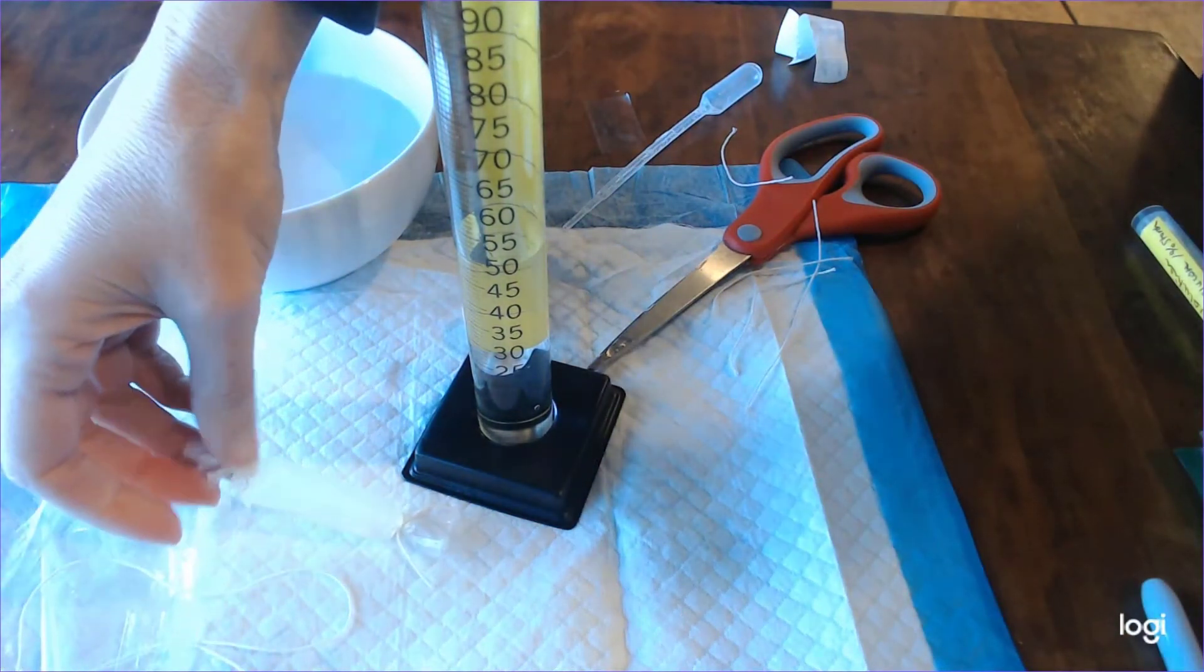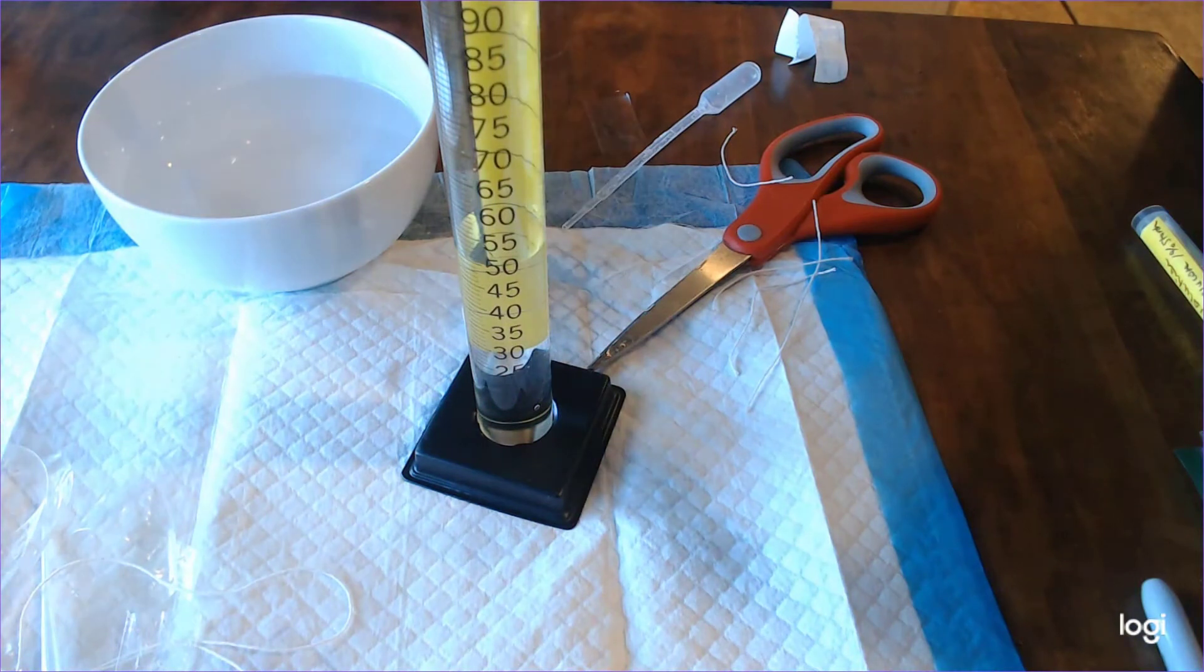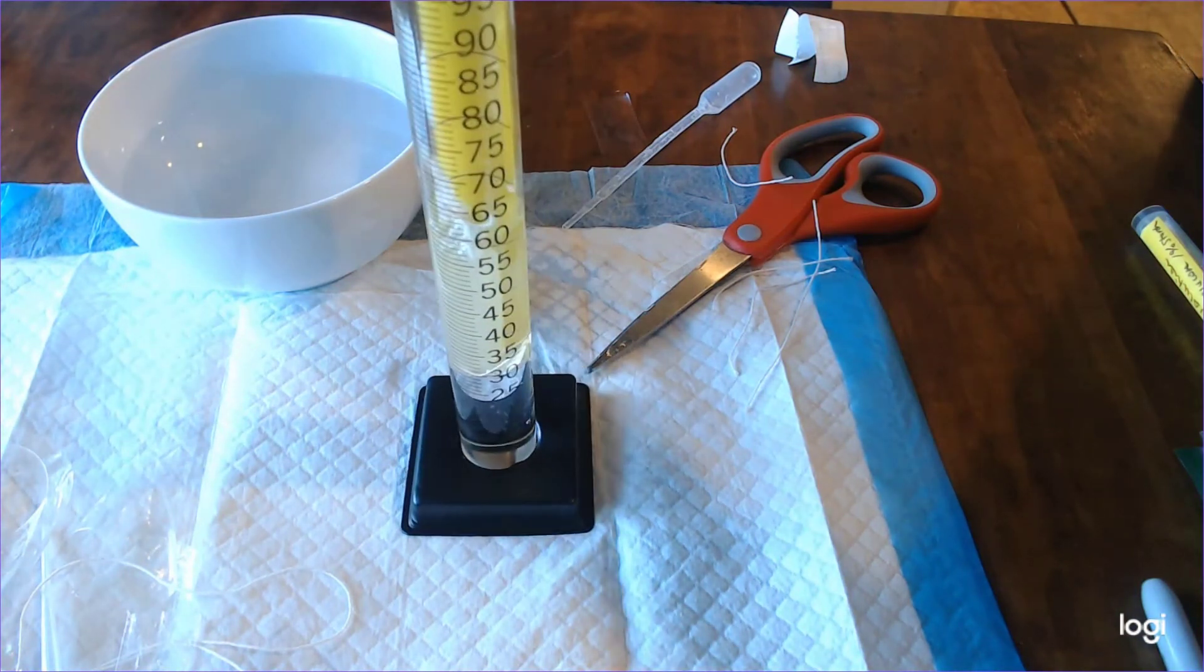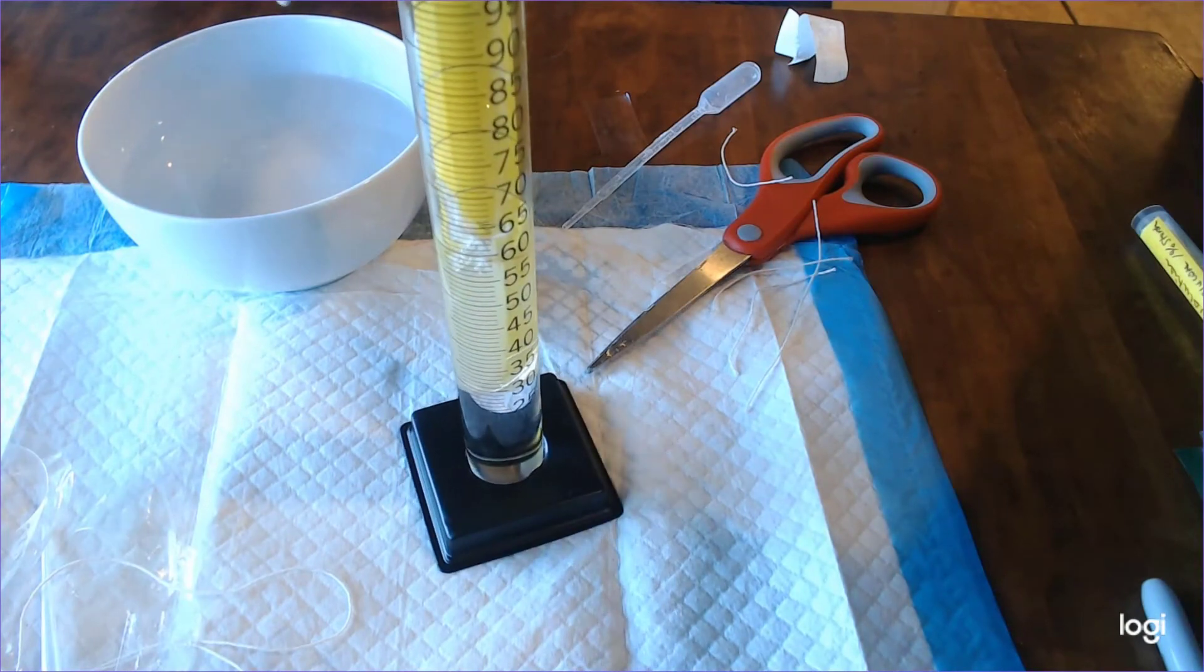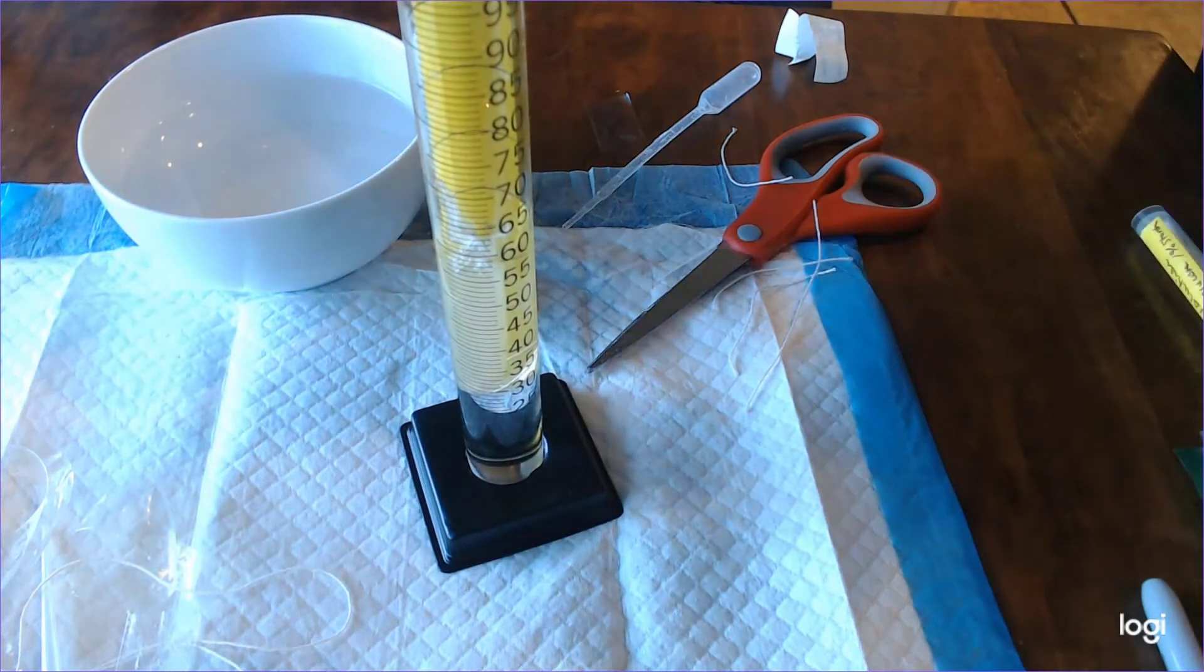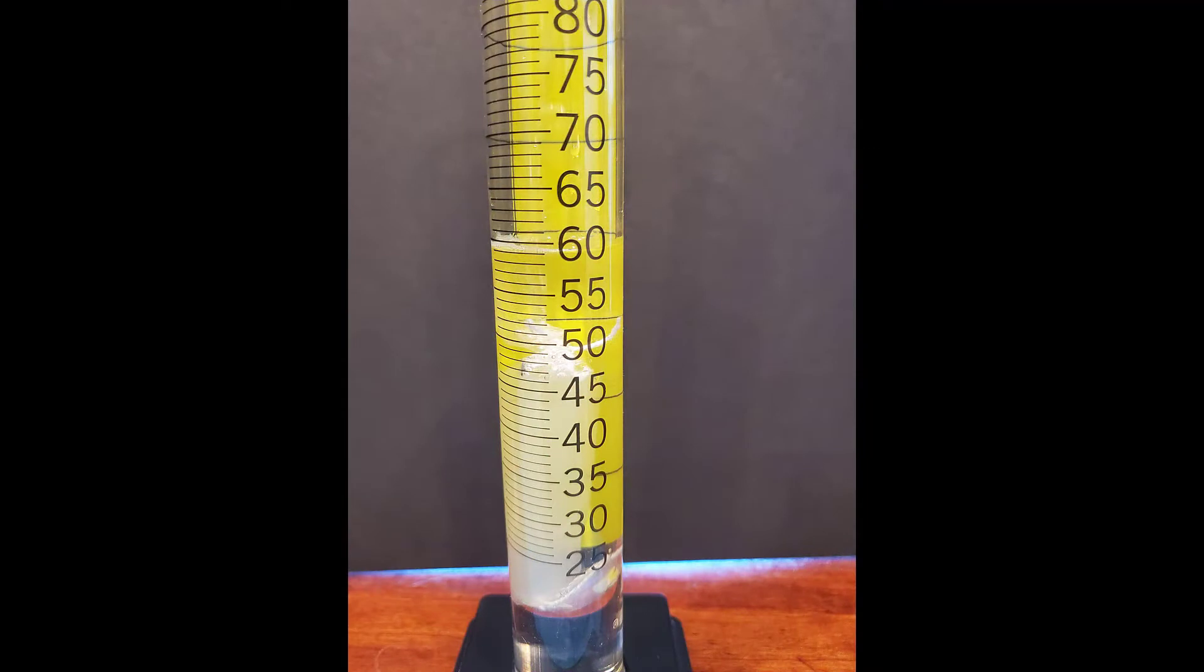I'm going to go ahead and take my dialysis bag and drop it in my graduated cylinder. And that is going to cause some displacement and I will be able to measure the final volume. From the difference between the final volume and the initial volume I will be able to record the volume of my dialysis bag.